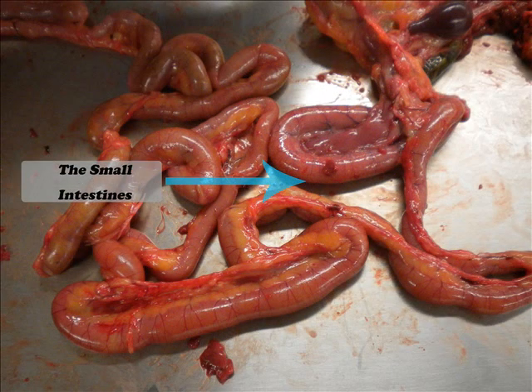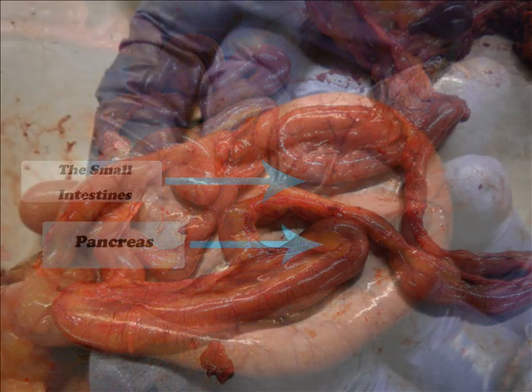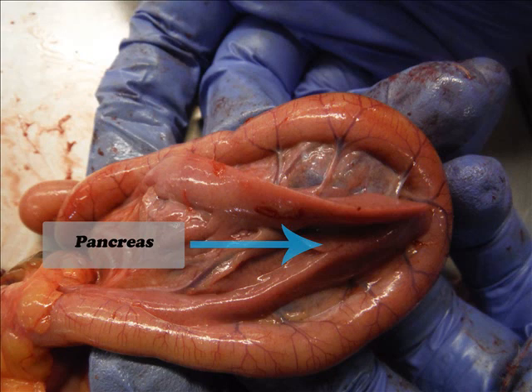The small intestine begins at the exit from the gizzard and ends at the junction of the small intestine, ceca, and colon. Its jejunum and ileum are posterior to the duodenum. The mesentery fixes the small intestine to the dorsal-abdominal wall and supports the superior and inferior mesenteric arteries and veins within the tissue. Much of the digestion of food and all of the absorption of all the nutrients takes place in the small intestine. The pancreas is located within the duodenal loop of the small intestine. The ducts are normally hidden by the tissue. The bile ducts enter the duodenum near the pancreas.